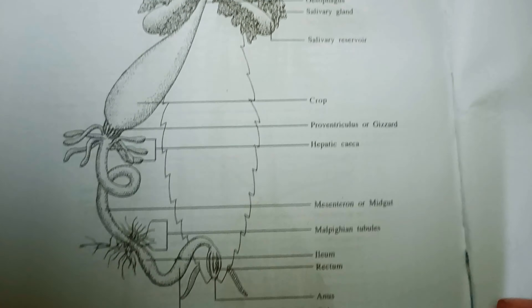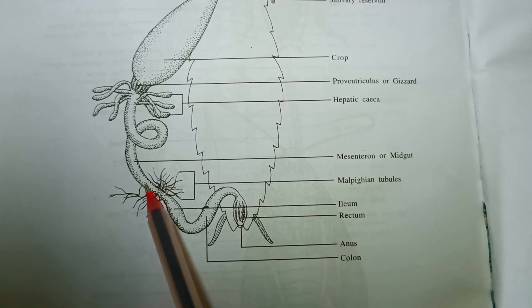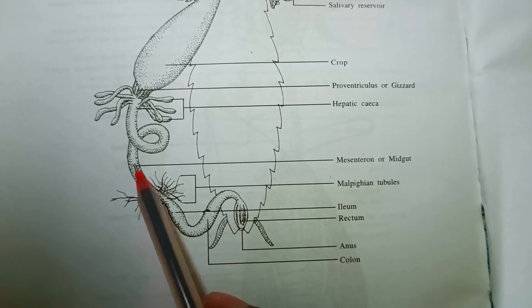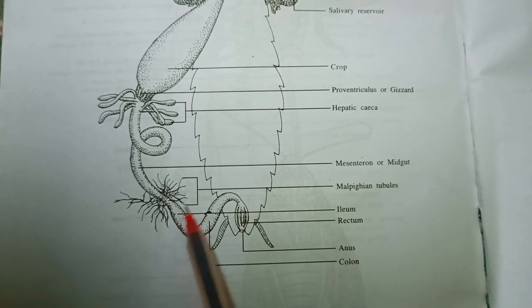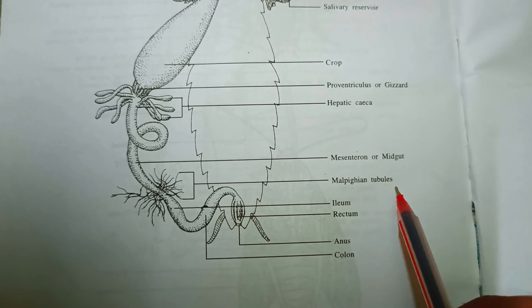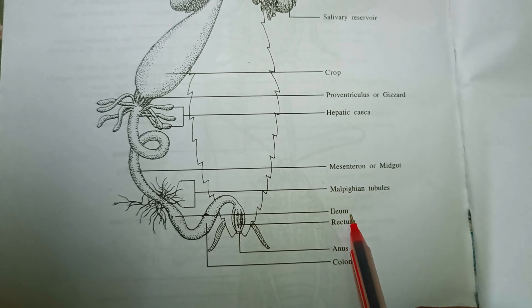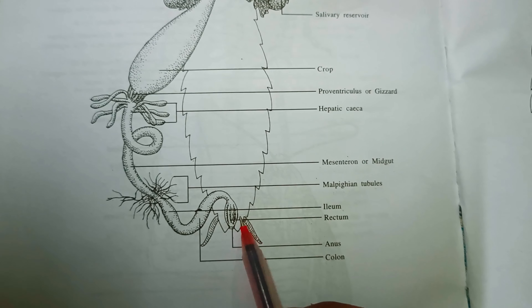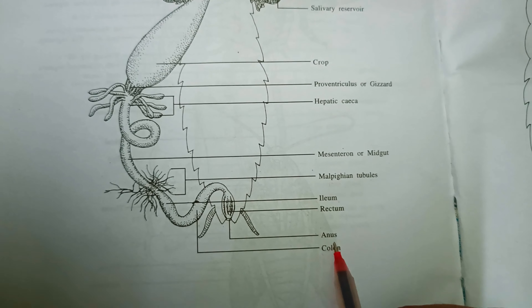And then this part is actually the midgut. And this part is actually the malpighian tubule. And then ileum comes, and then colon. This part is actually the colon. And this part is actually the rectum. And this part is actually the anus.